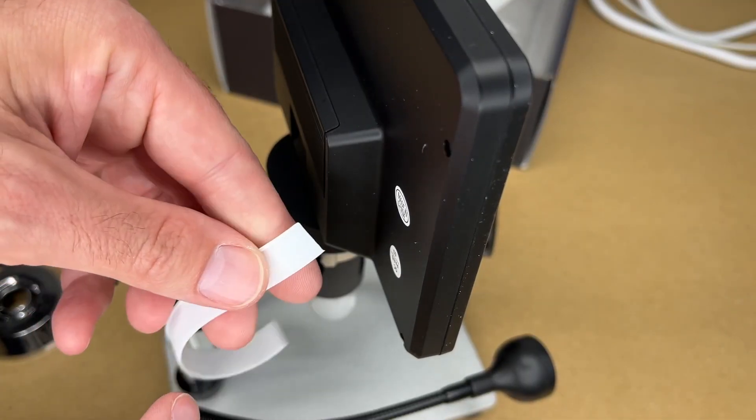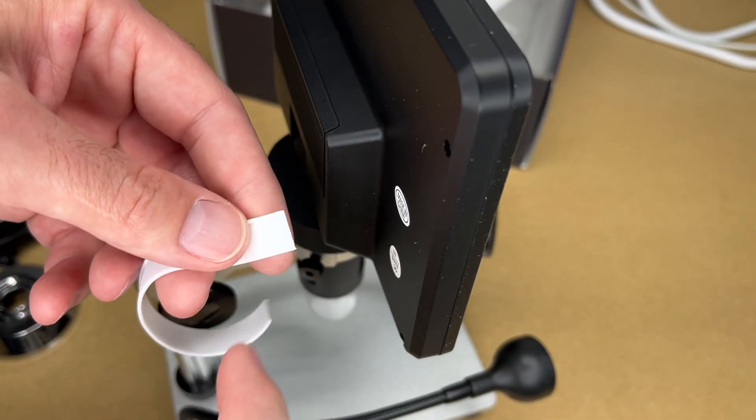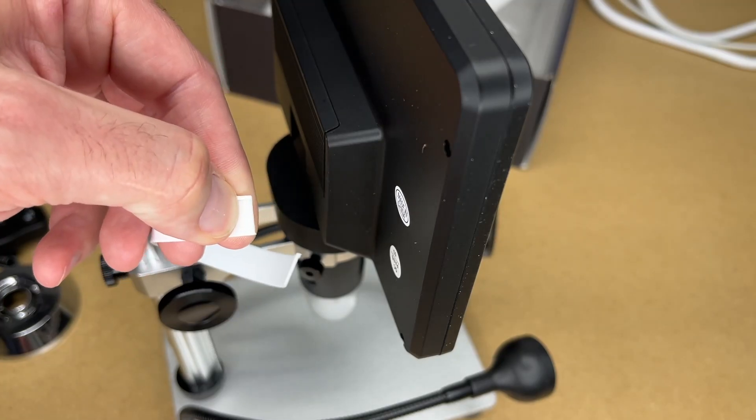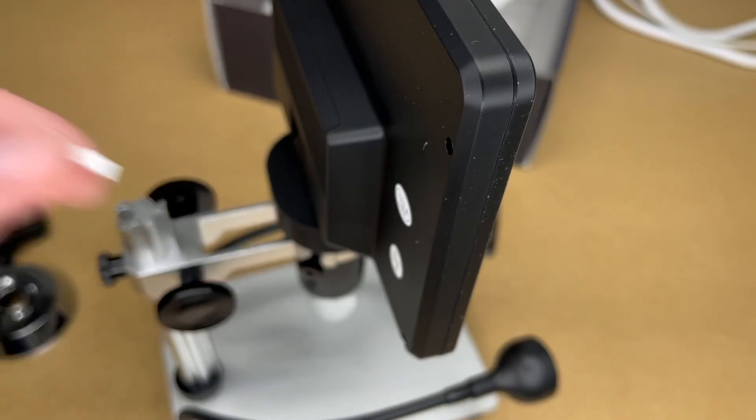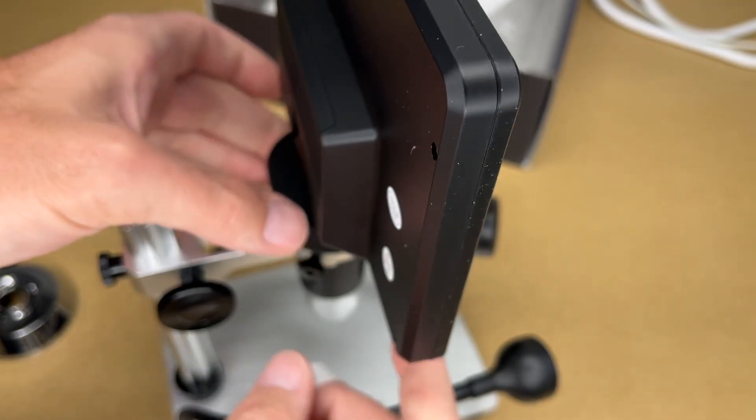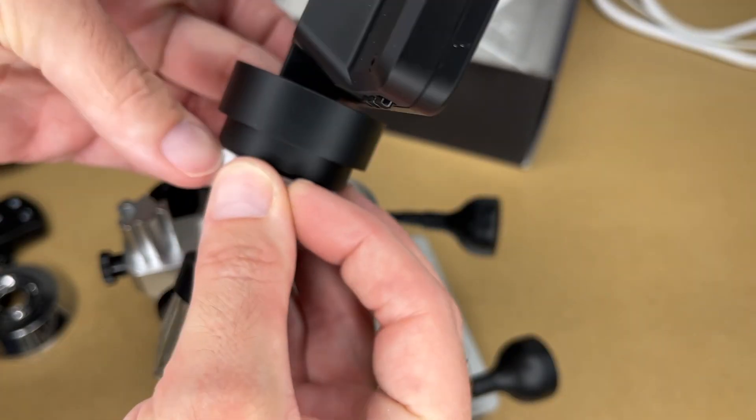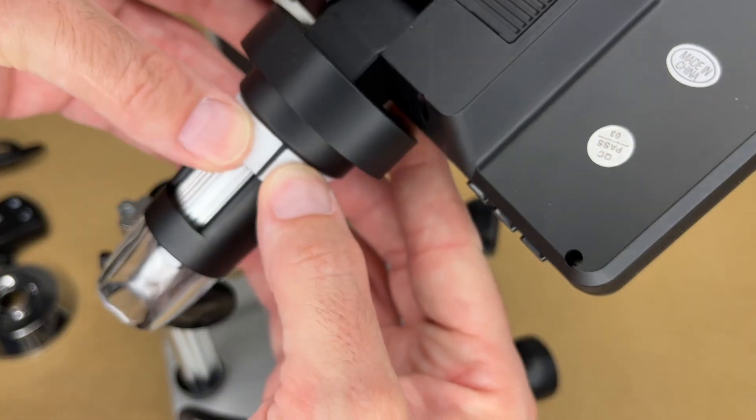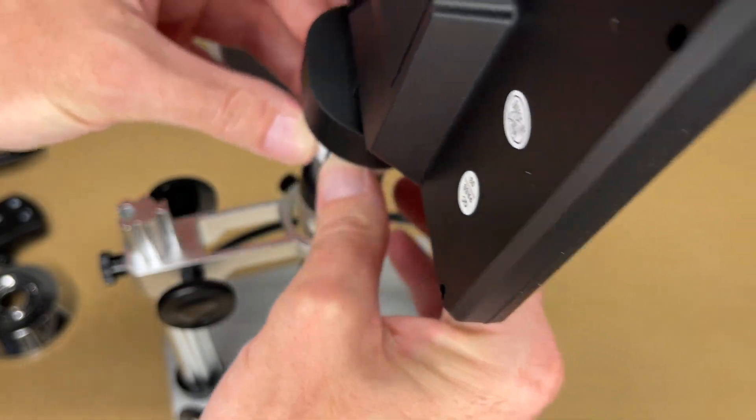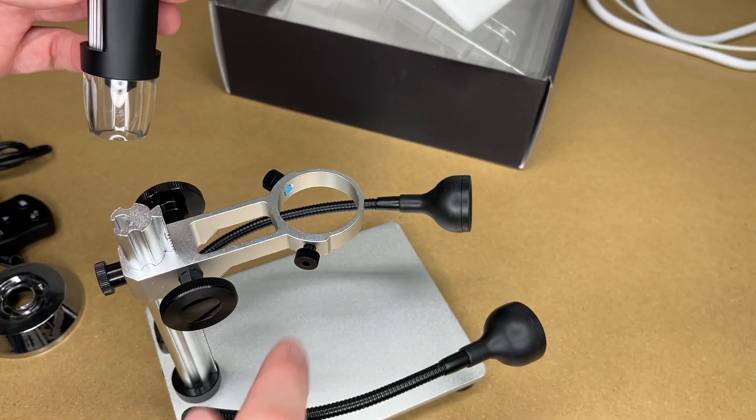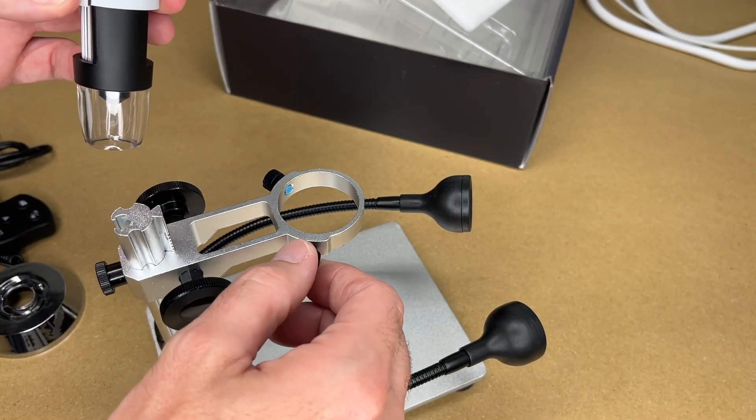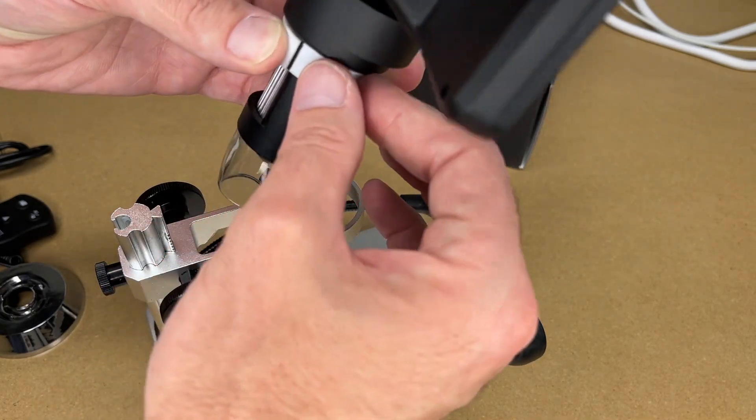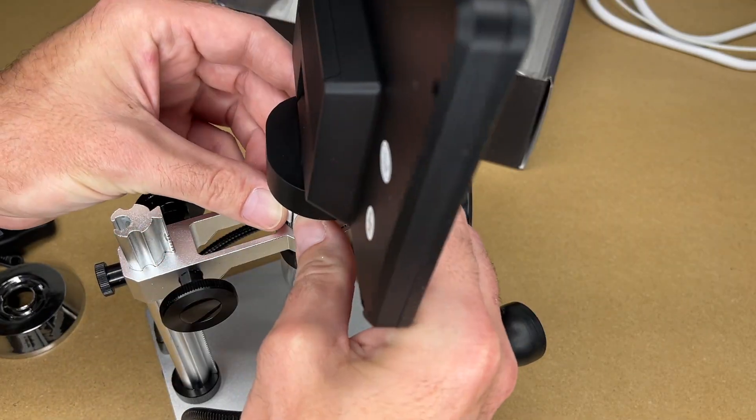So I feel like this could be a tiny bit shorter. So I'm just going to snip off just a tiny bit of this, maybe about that much. So I've snipped off that much. So I'll try this again. So now you can see I have a little bit of a gap there, but that's fine. And I want to make sure these are completely retracted here so they're not hanging up on the gasket.